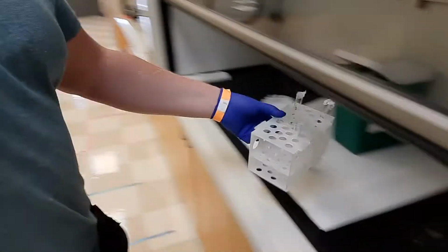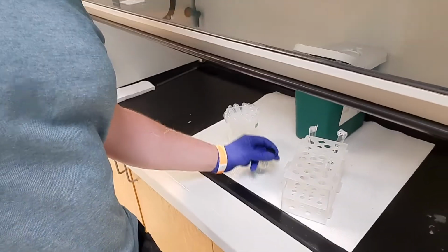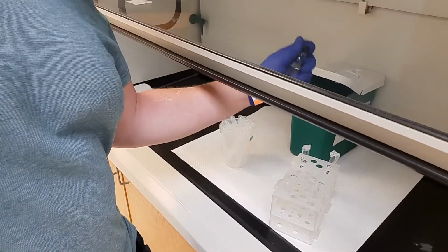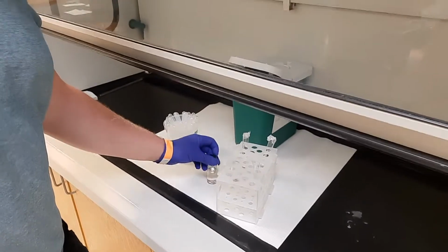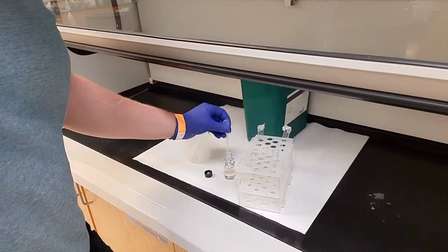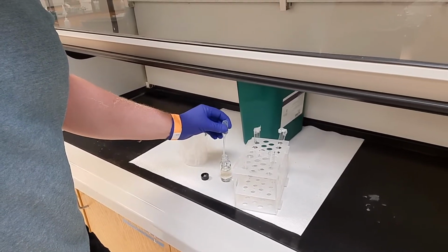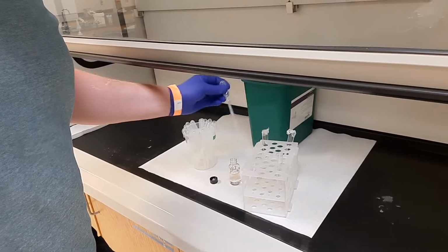Now, once I have my alcohol and my carboxylic acid mixed up in here, I'm going to take this over towards the hood, because in the hood we're going to have sulfuric acid. Sulfuric acid is a strong acid and needs to be handled in the hood just in case there's a spill. And I think it's 5 drops of this you add. It's about 5.